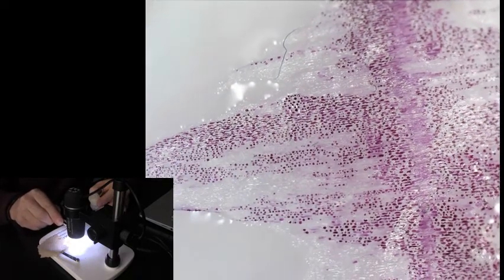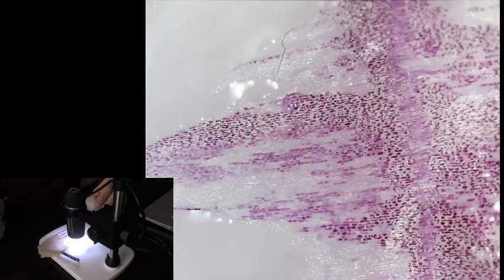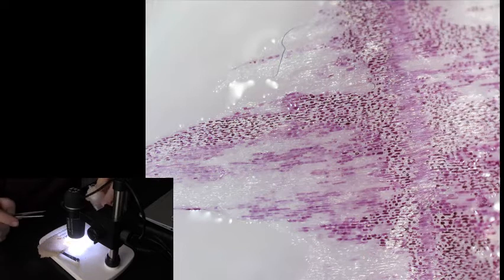Now, distilled water is 100% water, highest concentration that you can have. And remember, those cells were washed with salt water. So what's going to happen is this.